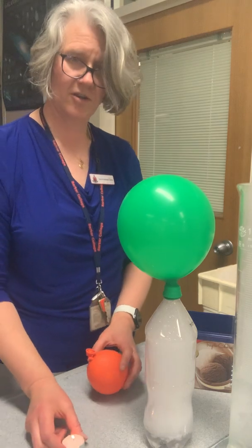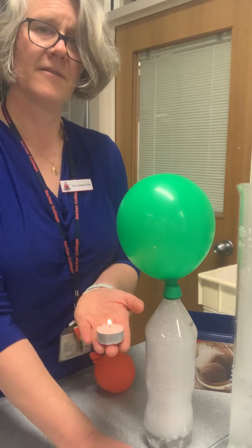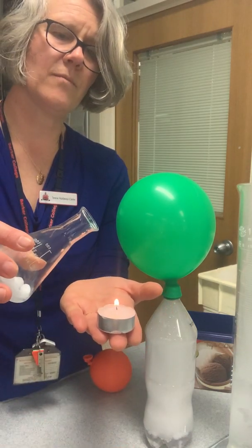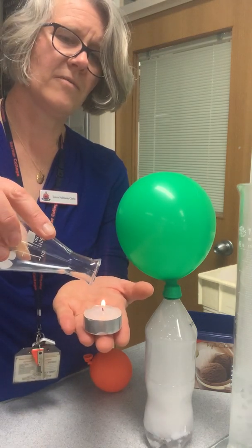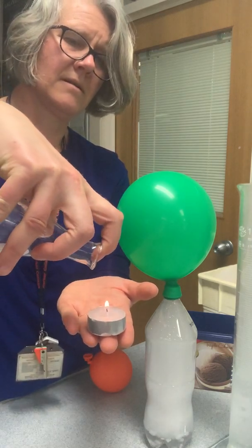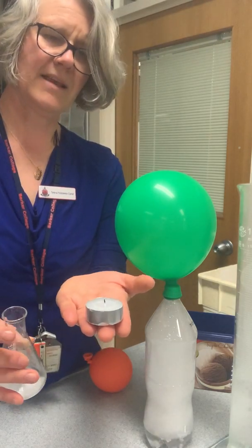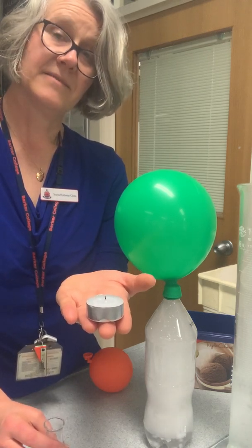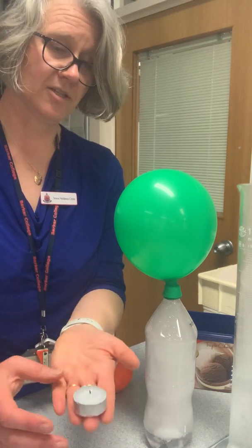Here I'm going to show you a cute little trick. Here I have a candle. Maybe I'll just hold it here. Got our candle here. Dry ice has been in here. I'm going to tip it up and pour the gas carbon dioxide out of my flask. Oops, that wasn't meant to happen. There you go. The carbon dioxide gas poured out of the flask onto the flame and extinguished it.